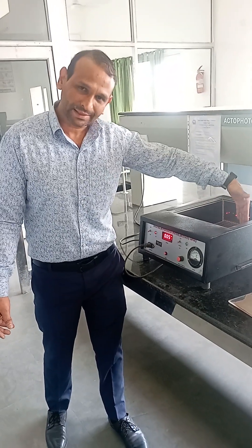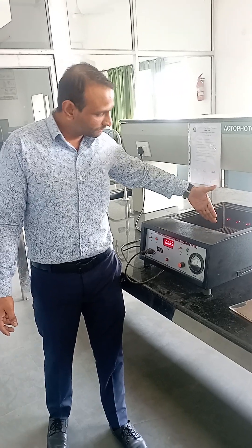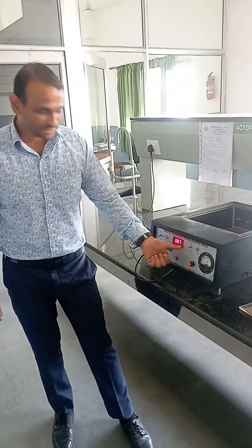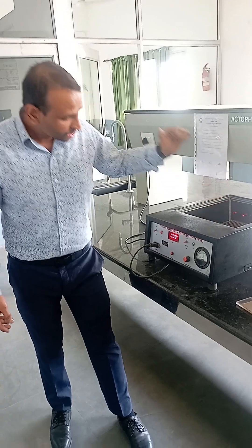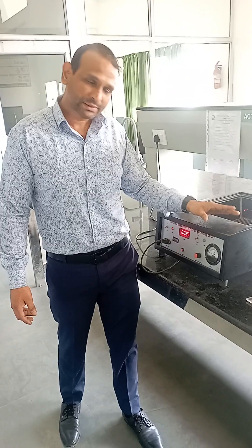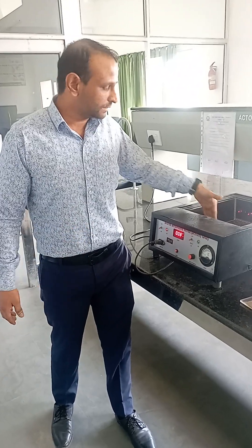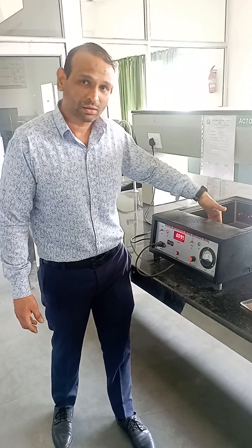After 30 minutes, you repeat the same procedure with the test group animals. The animal is placed again on the grid floor and starts crossing the photocells. The number of crossings is again reflected on the meter. After injection of the anti-anxiety compound, the number of crossings is reduced, showing the animal has calmed down with less movement on the grid floor.